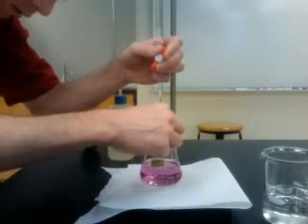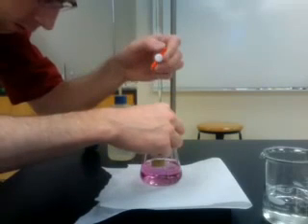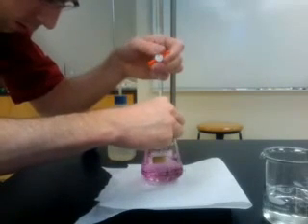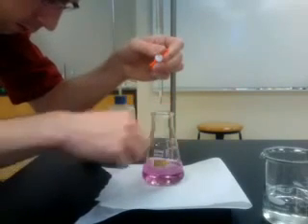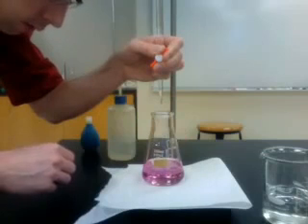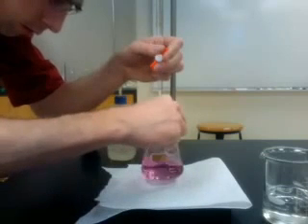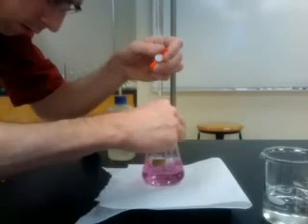The color change in this titration is very subtle and very gradual. You will have to be paying close attention to the color of your solution over the course of the titration. You will note that your titration starts out as a reddish-purple solution and gradually lightens in color, becoming more and more blue.